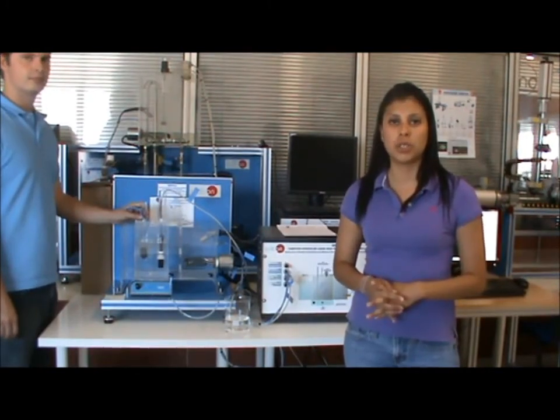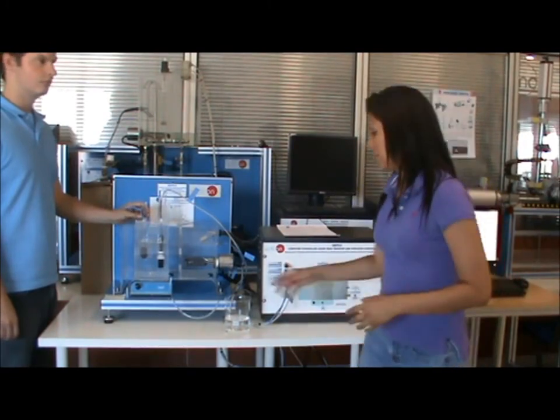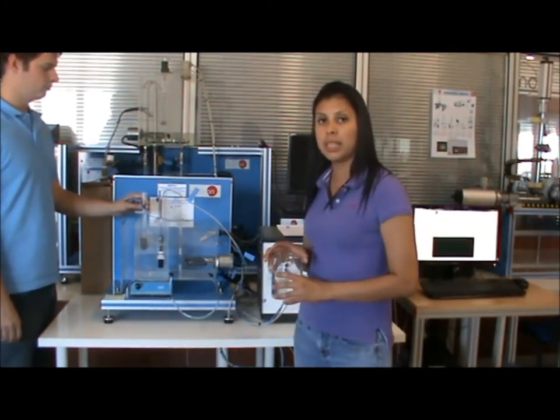First, you're going to prepare a solution of 300 milliliters of water and half of a mole of salt. Once you're done, you're going to pour it into the diffusion cell.